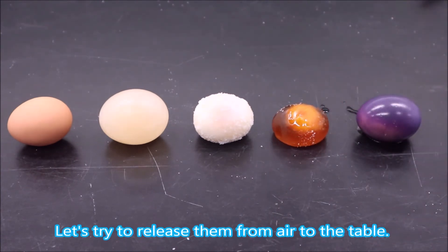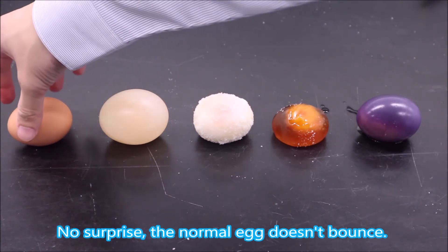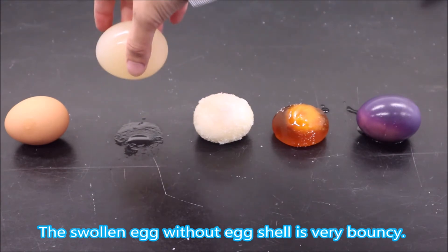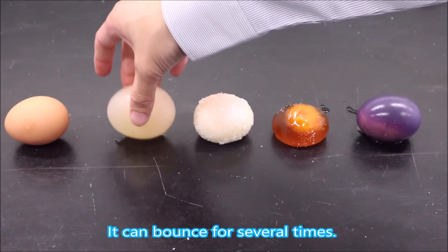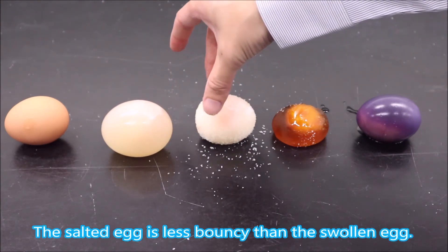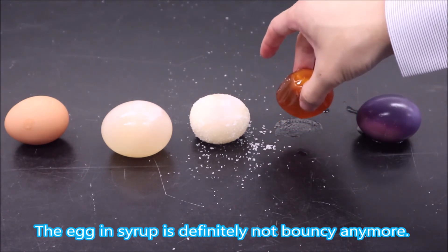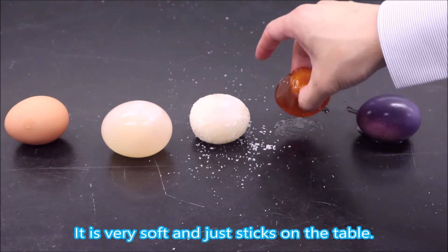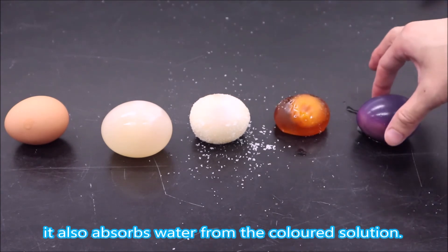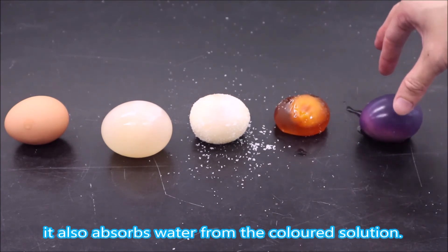Let's try to release them from the air onto the table. No surprise, the normal egg doesn't bounce. The swollen egg without eggshell is very bouncy — it can bounce several times. The salted egg is less bouncy than the swollen egg. The egg in syrup is definitely not bouncy anymore; it's very soft and just sticks on the table. Finally, the colored egg is bouncy because it also absorbs water from the colored solution.